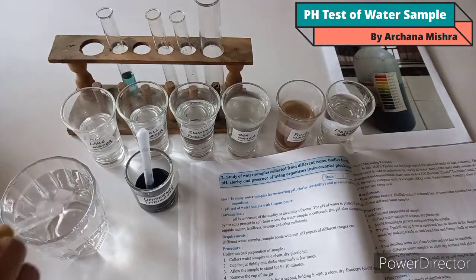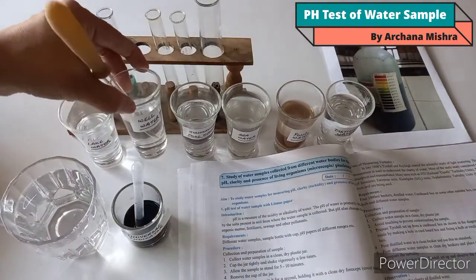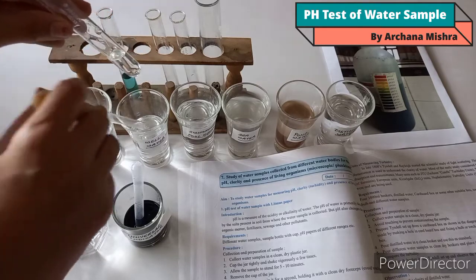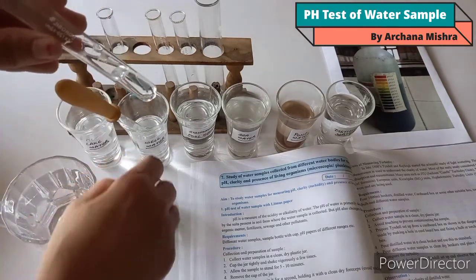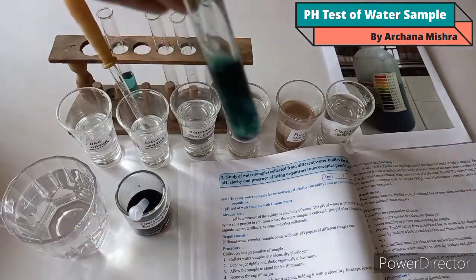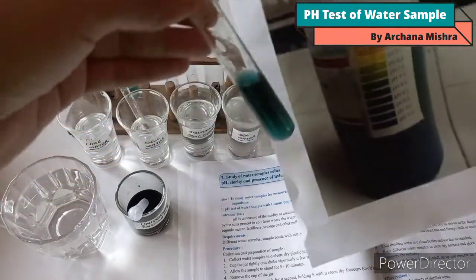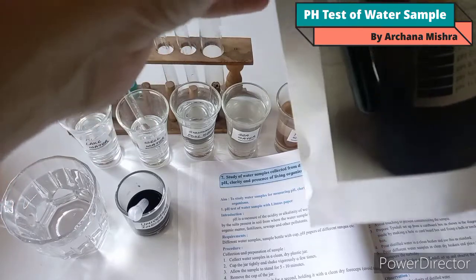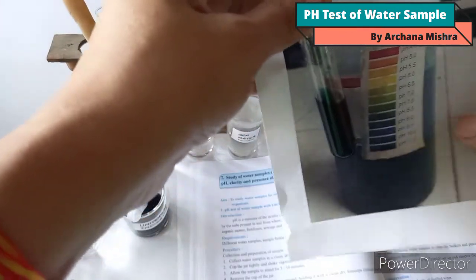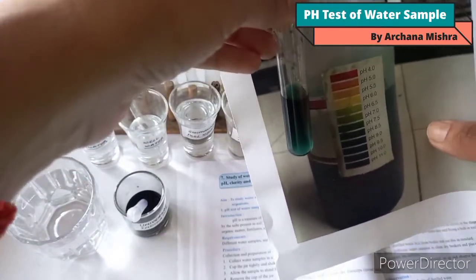Now for the next sample, I have to wash the dropper in clean water first, then take the well water sample. Take around 10 to 15 ml of well water in the test tube, then add 2 to 3 drops of universal indicator. You can see the change in color. Match it with the pH chart — the pH of well water is 8.5. We should always record our observation and note the color change after adding the indicator.